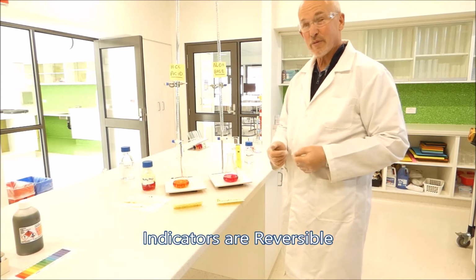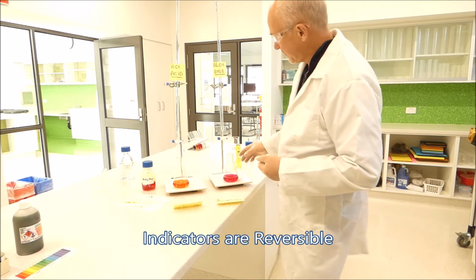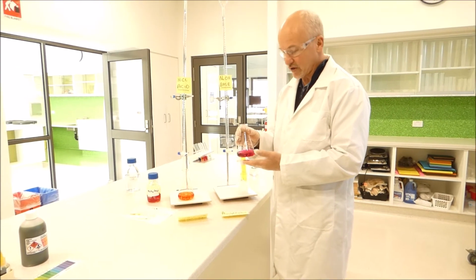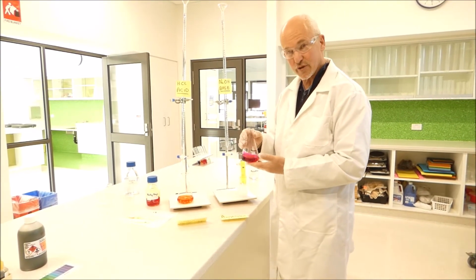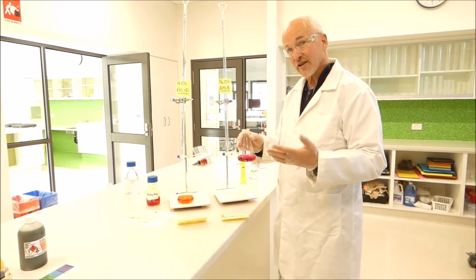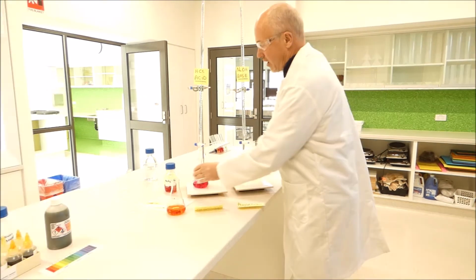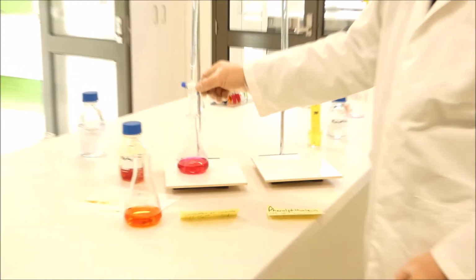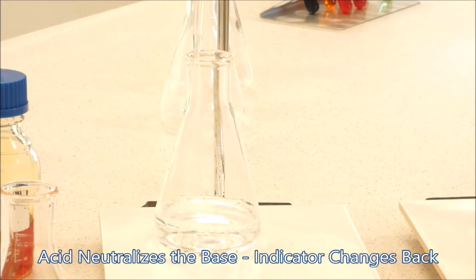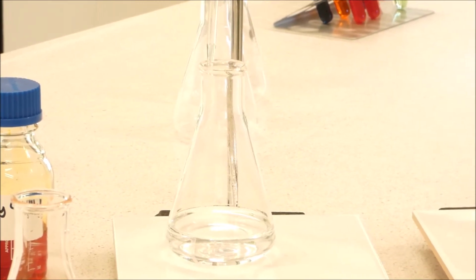Now the important thing to remember about indicators is that they are fully reversible. In the phenolphthalein solution here, we added a base, sodium hydroxide, to make it become basic and turn pink. Now if we add acid to that, we know that when we add hydrogen ions to hydroxide ions, they become water, become neutral. So if we add hydrochloric acid to the phenolphthalein solution, let's do it very gradually, magically it reverses and the pink colour disappears again, which tells us that the solution has become more neutral again.